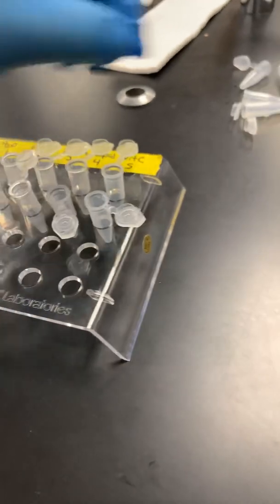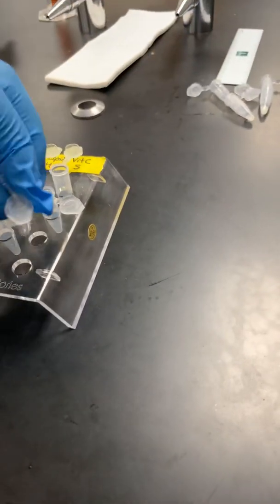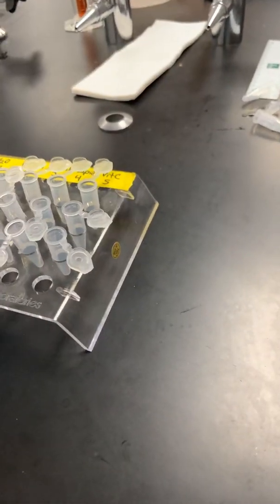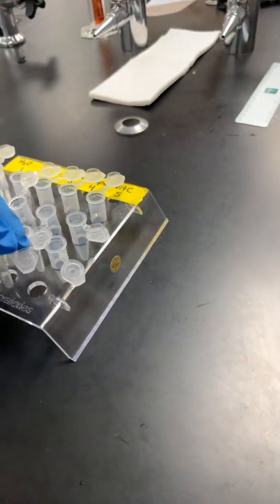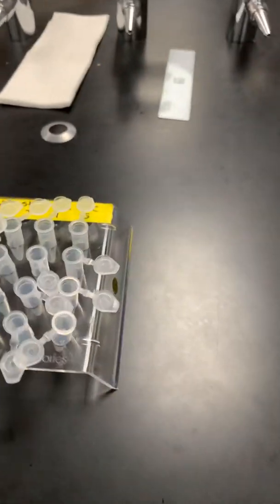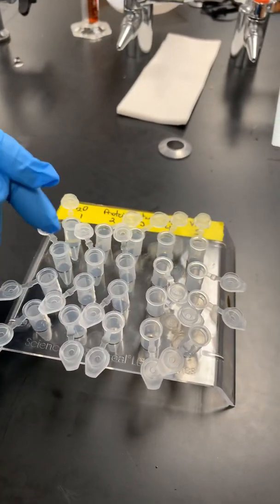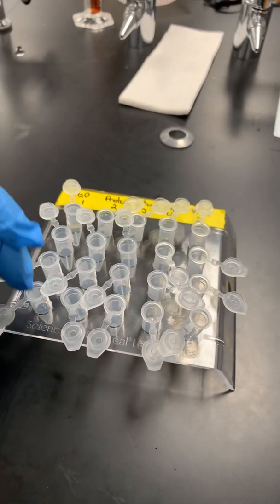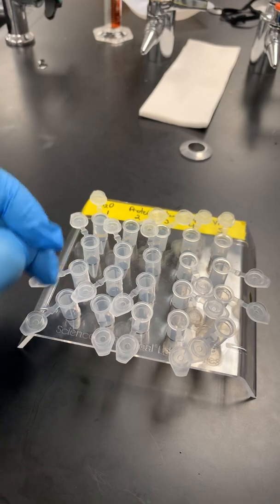And they will fit. Sometimes you have to turn the lids around a little bit so they'll fit, but they will all fit in there. So now you've got 20 tubes in there, 19 and 20. So there's 20 tubes there. Now what you need to do is transfer down each set here and distribute this 1.5 mils evenly into these 3 tubes.